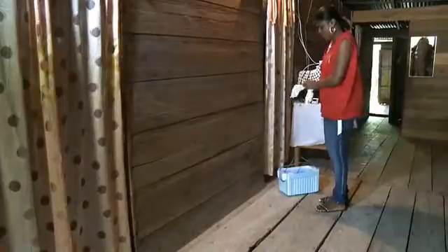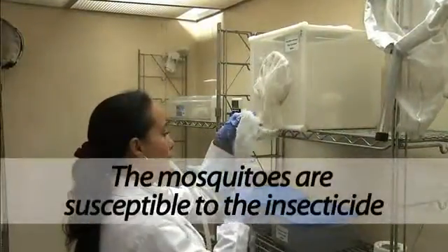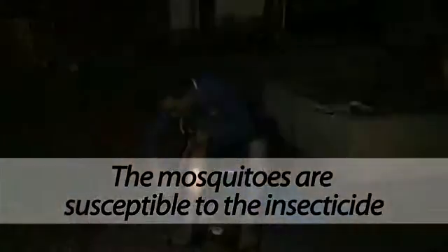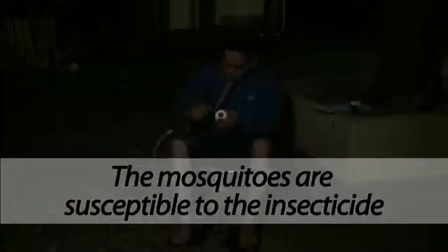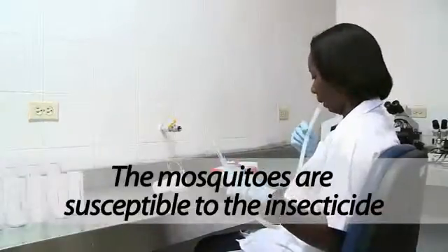There are a few general considerations to be aware of before starting. These include: usually fully susceptible mosquitoes reared in an insectary are used in the evaluations. Where this does not exist, then it may be necessary to use field-caught mosquitoes for the test, although it is less than desirable. In this case, it is important to determine that the field-caught mosquitoes are fully susceptible before conducting the test.